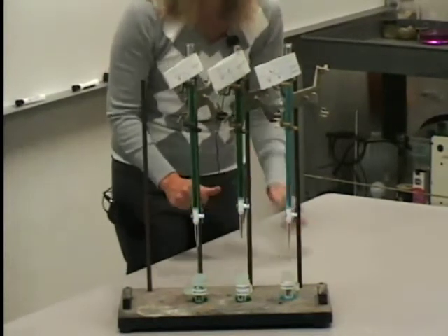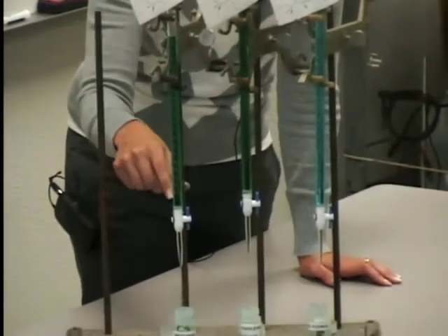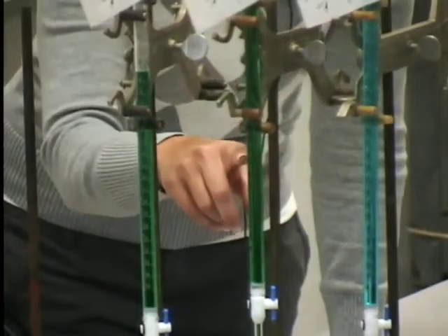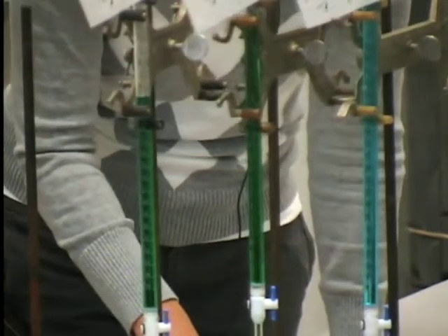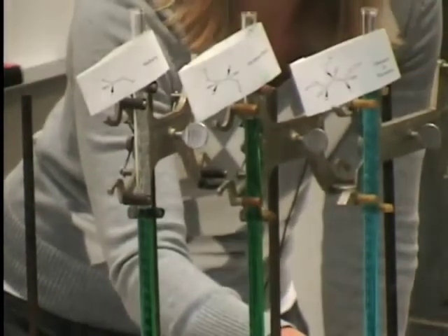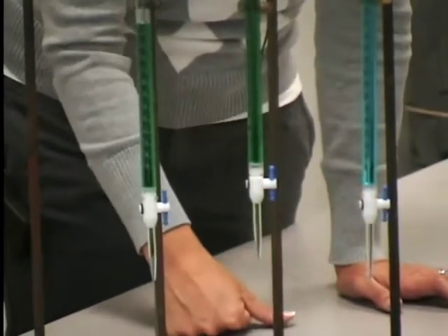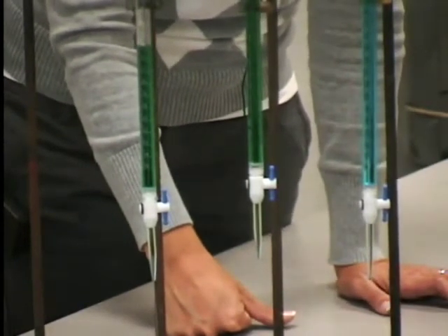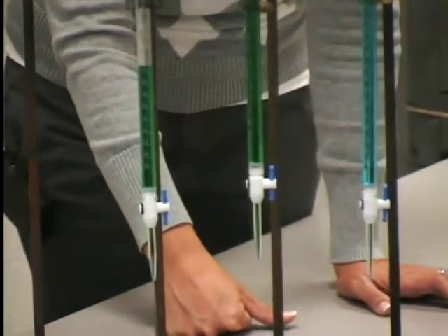What you hopefully can see is that with the methanol, even if you can't necessarily see the stream coming out, the liquid level up here is draining pretty rapidly. The ethylene glycol next to it is coming out at a pretty good pace, but it's not draining nearly as quickly as the methanol. And if you look over at the glycerin, just a drop or 2 is coming out every few seconds. The drops are forming very slowly, and it would take hours for this burette to empty of that glycerin. So we'll let that go just for a minute so you can see that contrast.